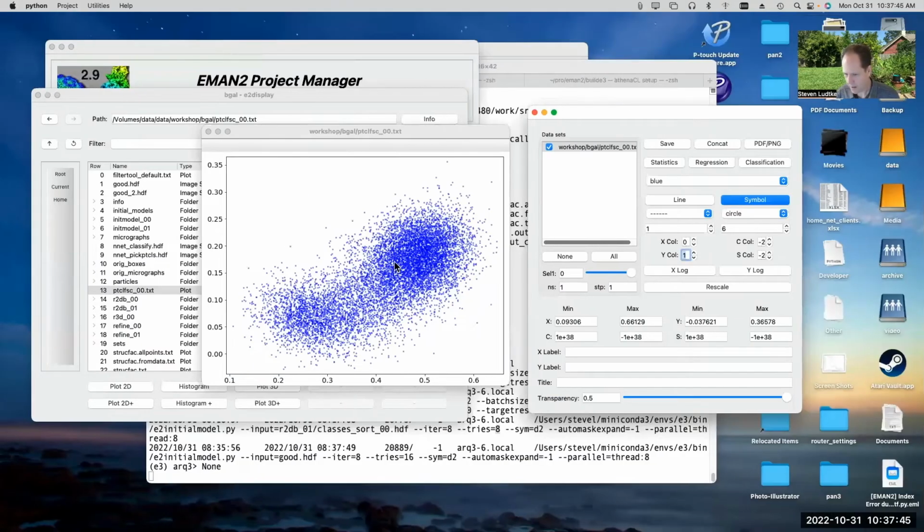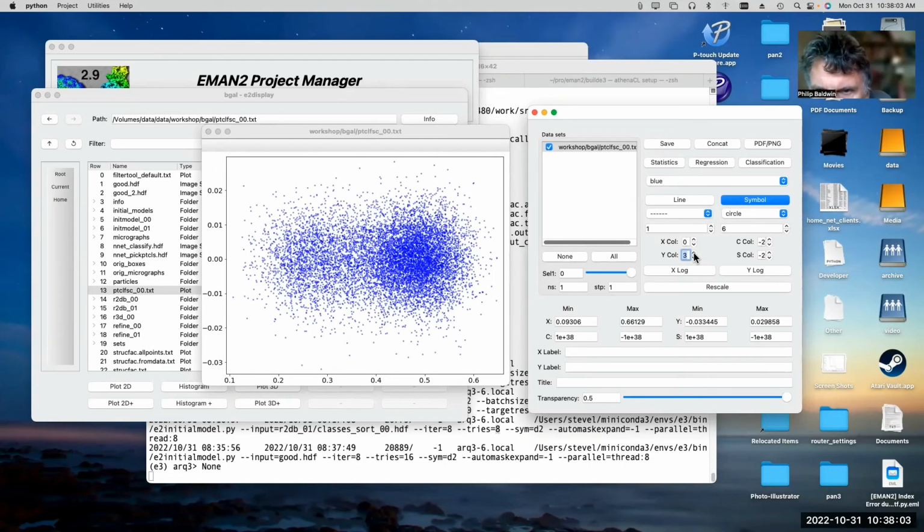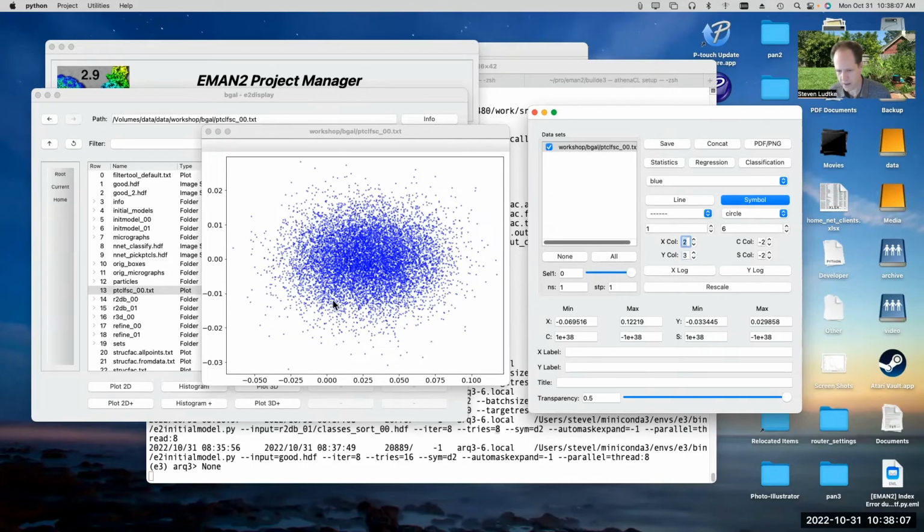So we can plot on the x-axis the very low resolution features, and then on the y-axis the next notch higher. If we do the next one, we can still see we're getting a little discrimination on the y-axis, even at intermediate resolution. And now we're not getting very much at all. So if we plot, say, 2 versus 3, we're not seeing much of a distribution. This is the second highest resolution band versus the highest resolution band.